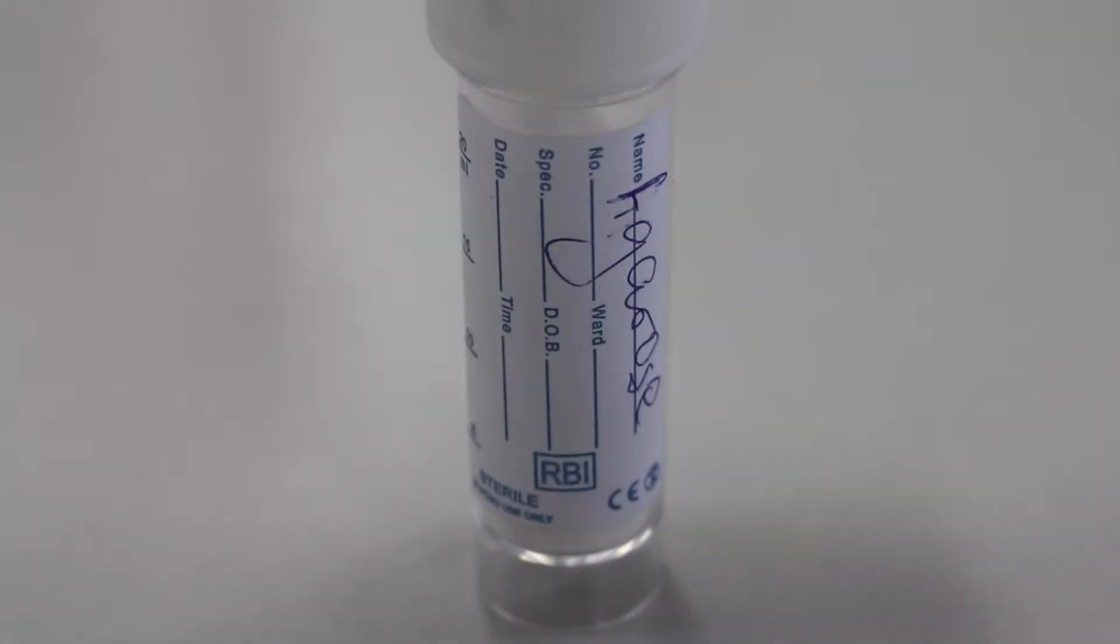To prepare the gel, the following are needed: agarose, 1x TBE buffer, and gel red.